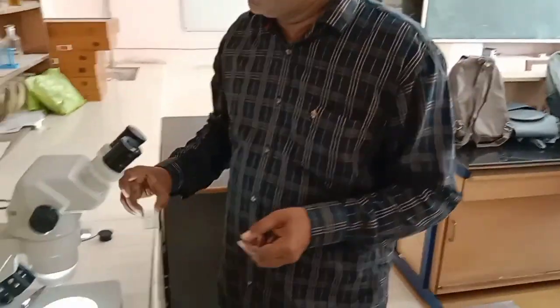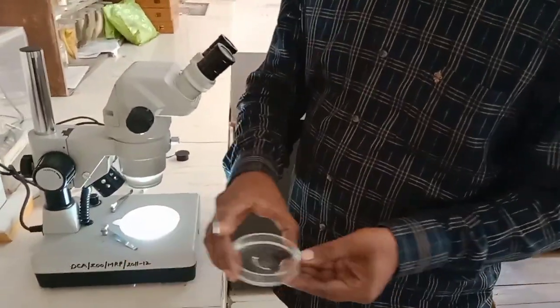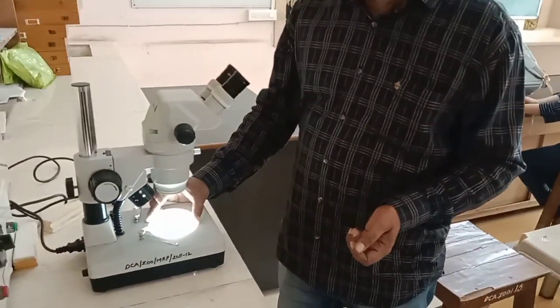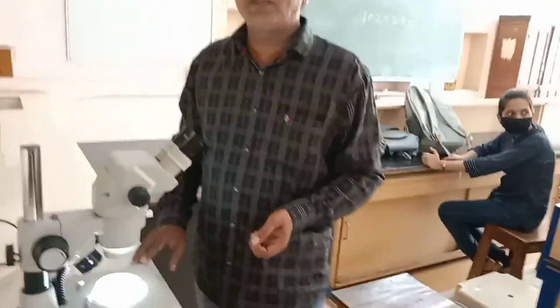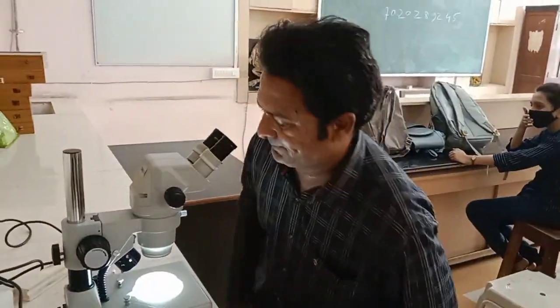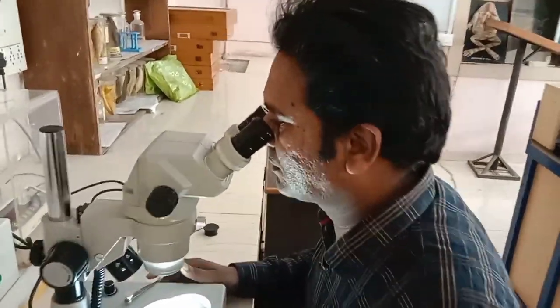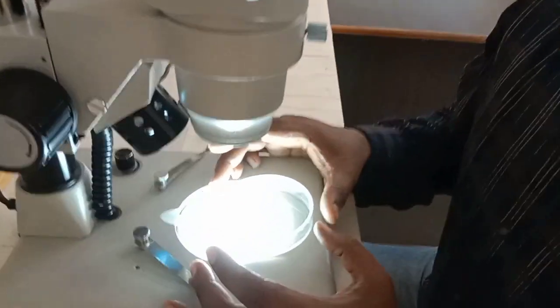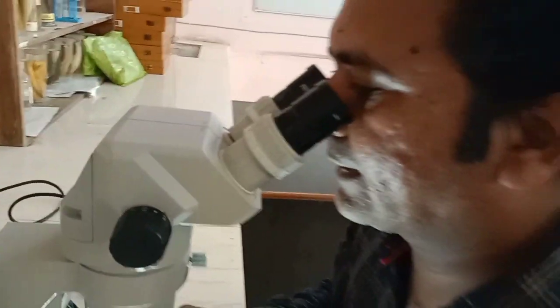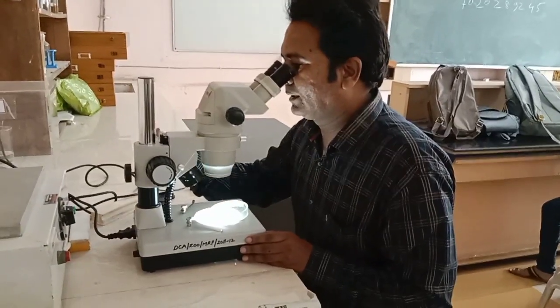Now I will show you what we have collected. This is a sample. I will just focus this sample here in the microscope and then we will see if there are some soil or plant nematodes. Now here I am observing this sample under the stereo microscope, and I can see soil nematodes clearly in this stereo microscope.